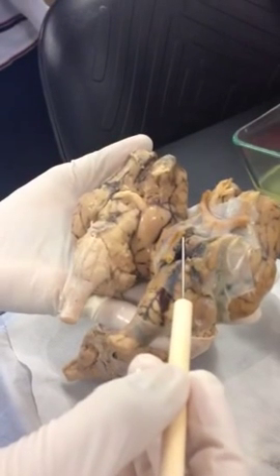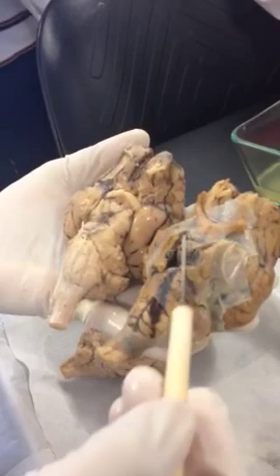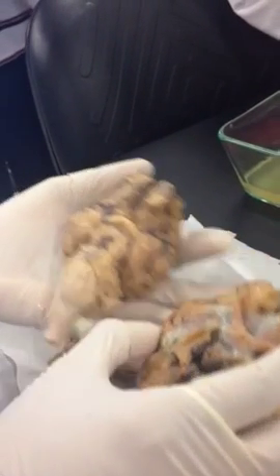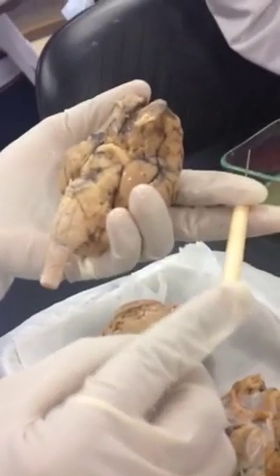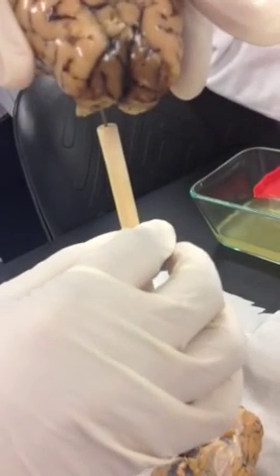Okay, you will see it in another picture. The word will be in another page. This is your pituitary gland. Okay, so how is it hanging? So imagine this is my pituitary gland, this is the stalk, so it will be hanging like this.